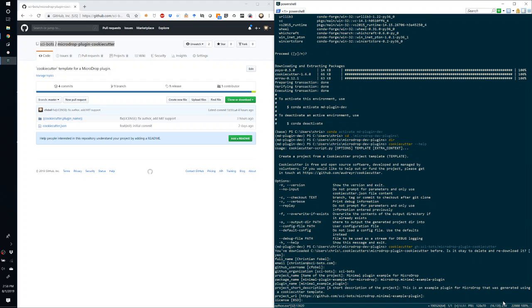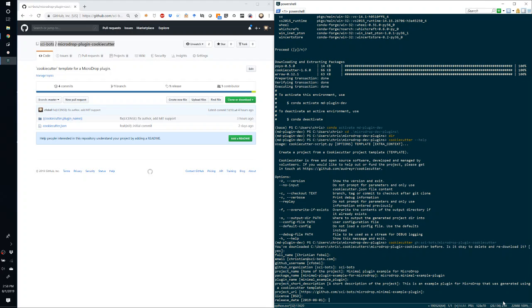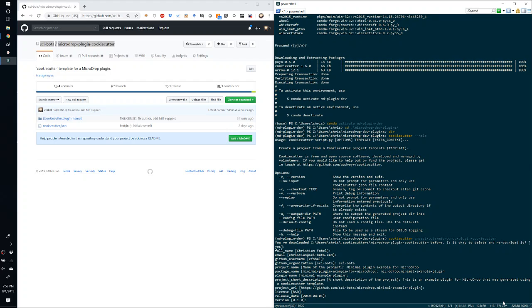The license by default is BSD. MIT can also be specified here. And if you specify either BSD or MIT in all caps, then the corresponding license file will be generated, and anywhere where the license is listed in the repository will be updated accordingly. The release date and the version number.